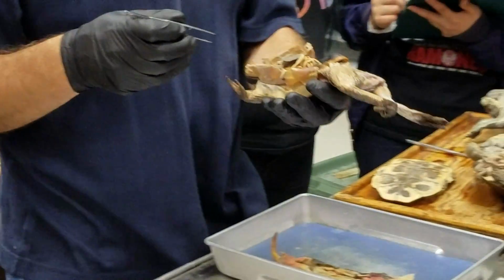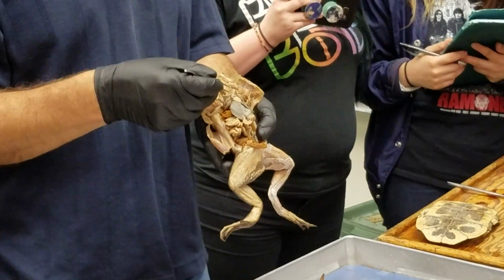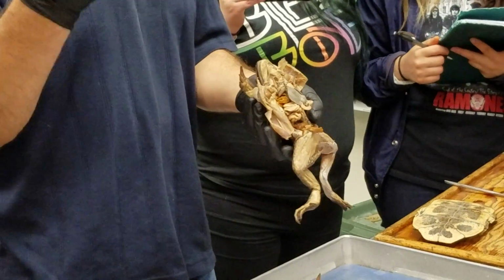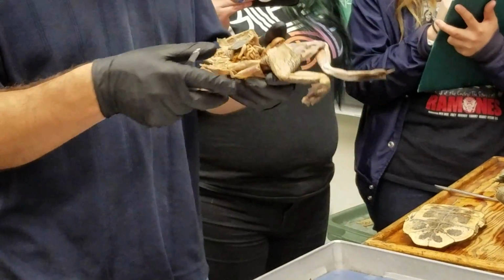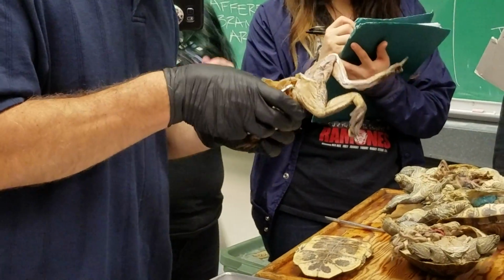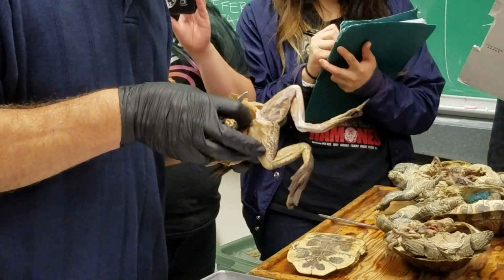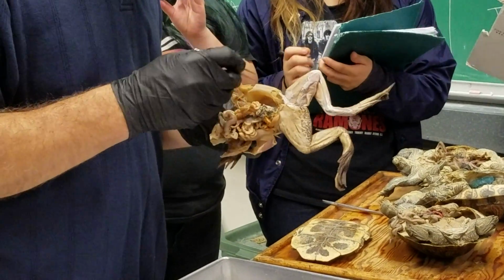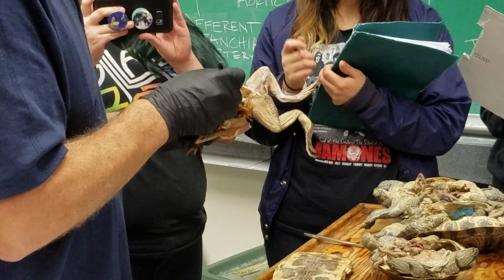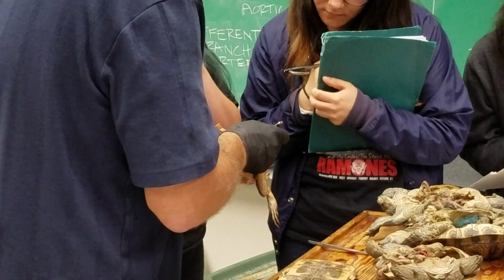Okay, cool. So you see how there's this truncus arteriosus that gives rise to these three main branches, the third, fourth, and sixth aortic arches. And the last thing I want to show you is if we follow the systemic arches around, like this here, you can see how the systemic arches from the two sides come together here to form a single dorsal aorta.